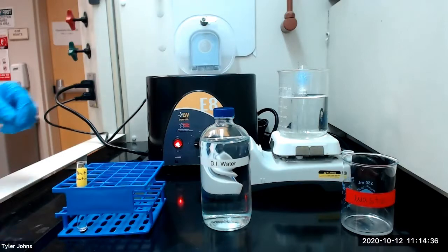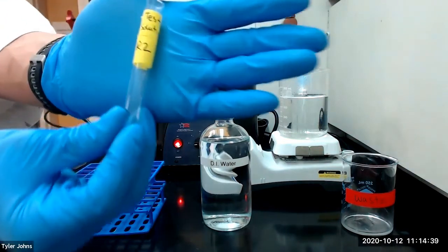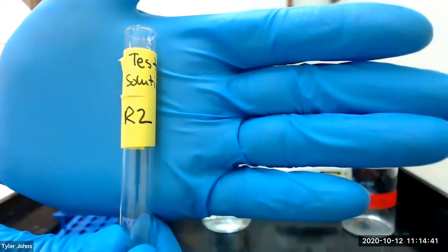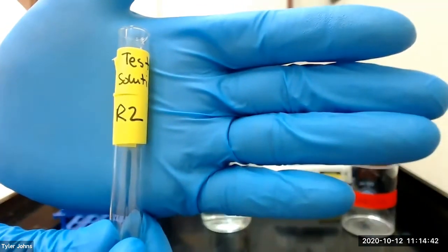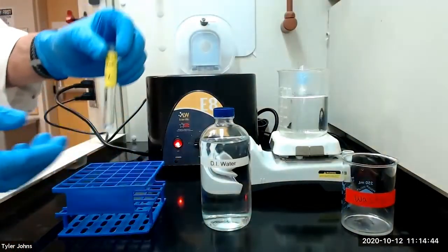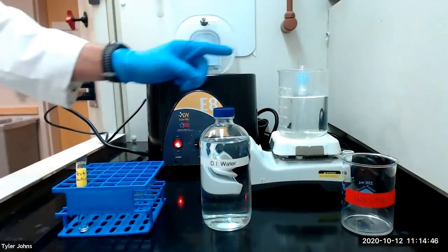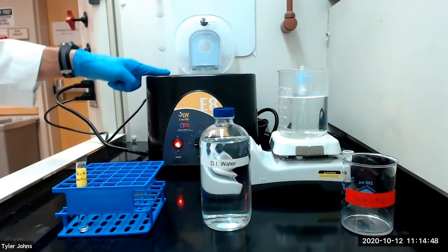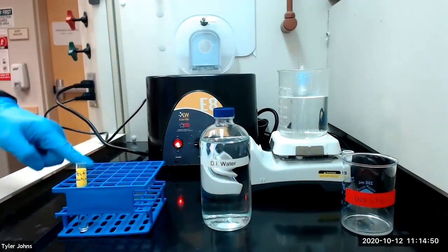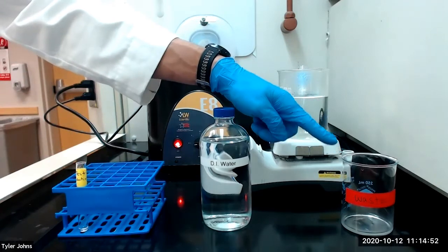We next need to wash our remaining residue, which we will designate as R2 for residue two, with several portions of boiling hot deionized water. We'll centrifuge and discard the washings in a waste beaker.